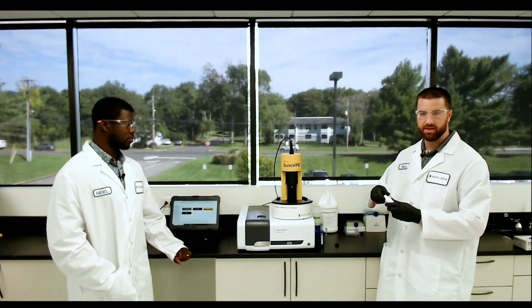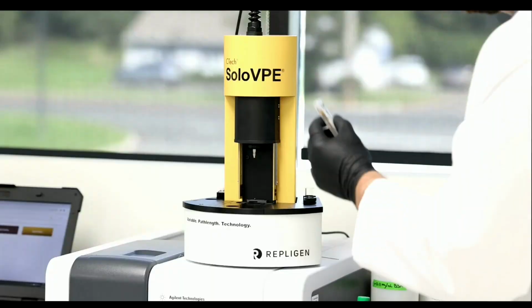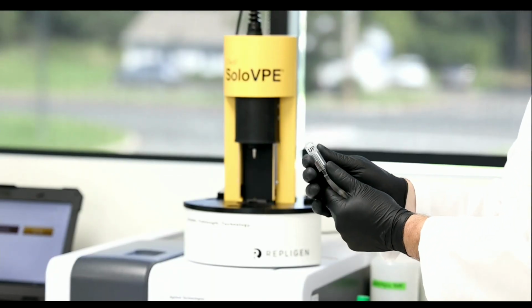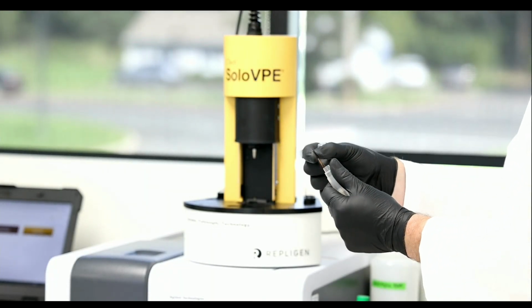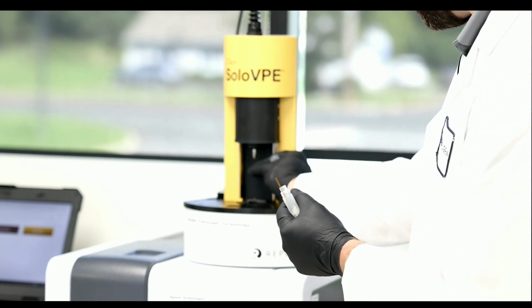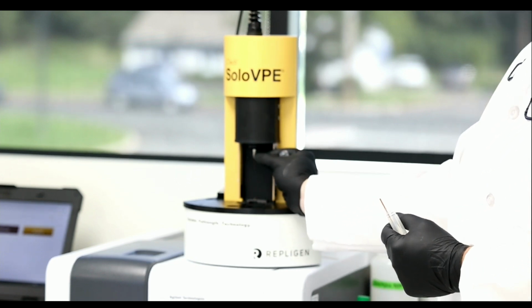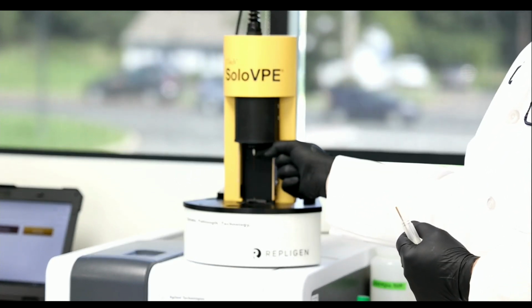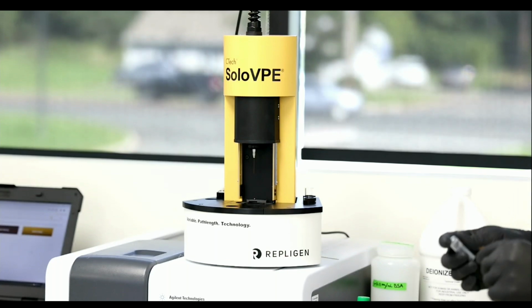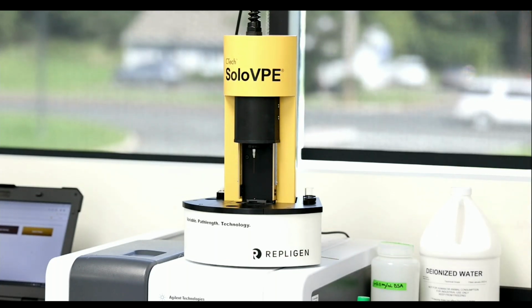Typically, your fibrettes come in containers like this, but each system will come with fibrette dispensers so that you can take fibrettes one at a time from the side, and then basically you just insert like this. You push up till the fibrette slides along your hands, and then you're going to actually push up on the silver piece, and that pulls the fibrette down a pinch. I'll explain a little bit about why we're doing that action when we're running the sample.